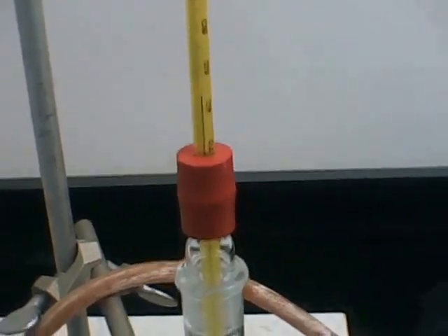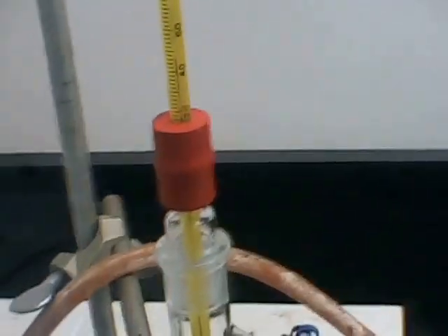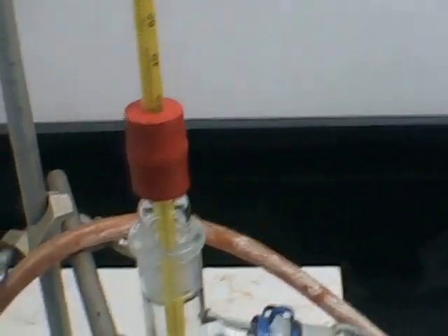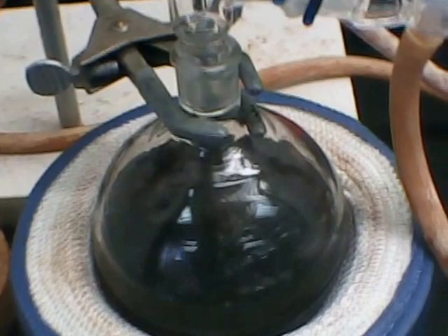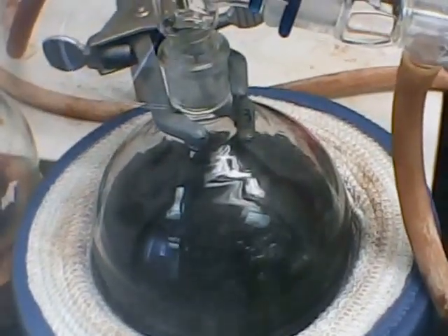And we're not at sea level. Water here boils at our altitude at about 98 degrees Celsius. But I started to get distillate at about 40. I'm about 44 now. 45 degrees. So I want to get an idea of what I will be getting.